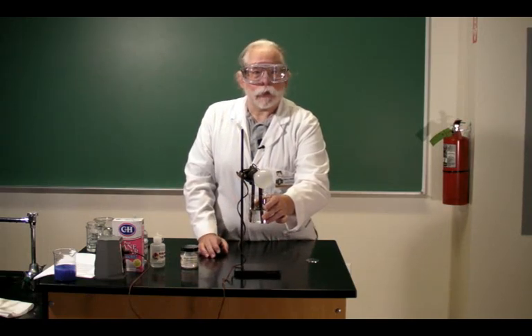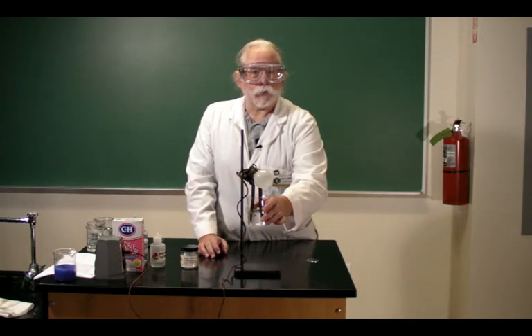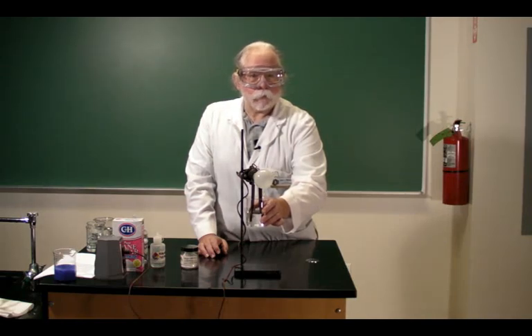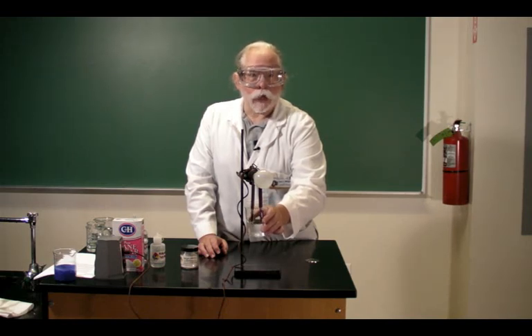I will put the electrodes of the apparatus into the beaker of water. There's no light coming from the light bulb. If I dissolve a material in this water and the light lights very brightly, the dissolved material is called a strong electrolyte.